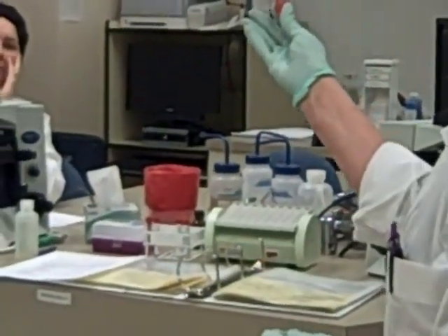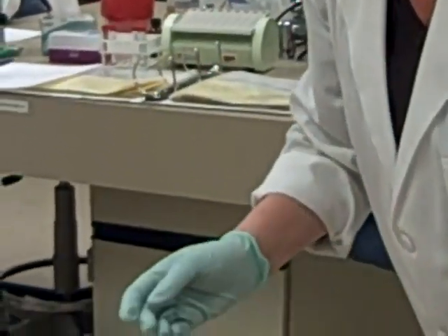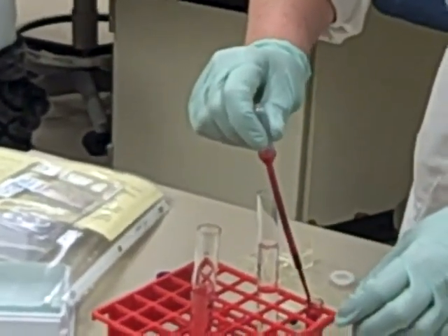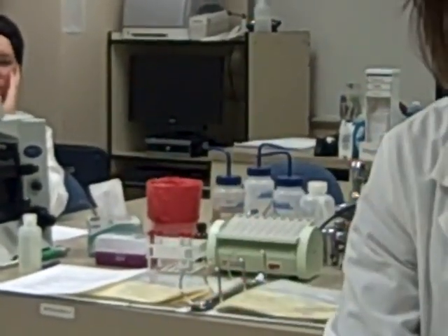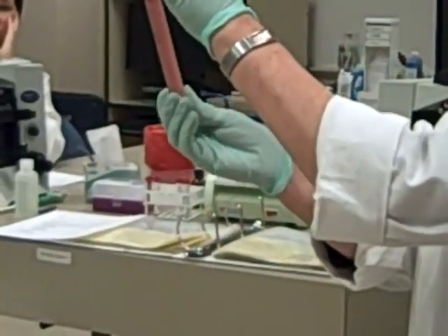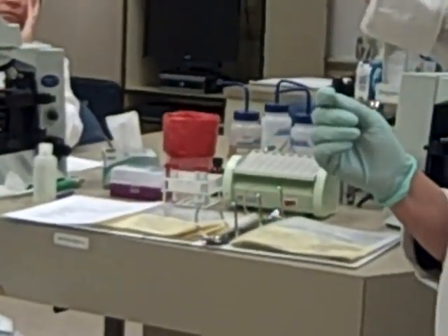We see how that's just 1 drop of blood, and it makes it look red and hazy. What do you think will happen if I add a drop of blood to deionized water? The lysis, yeah. Not right away, but it'll turn clear really soon.